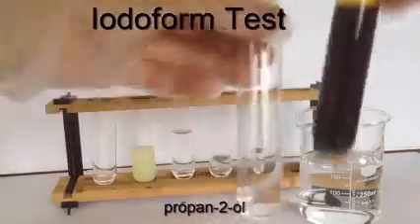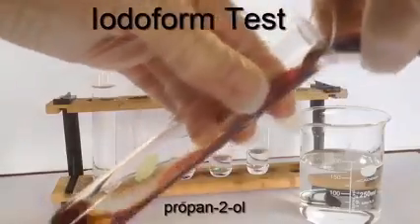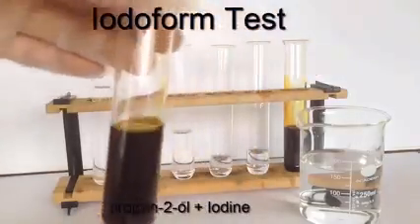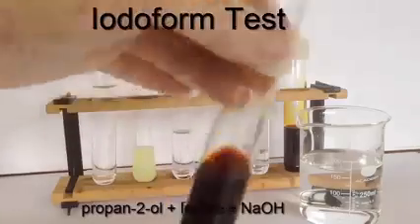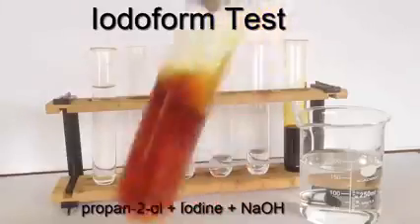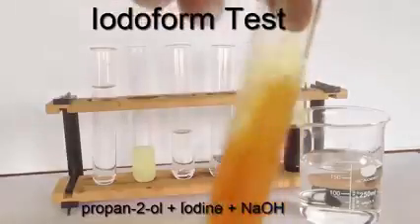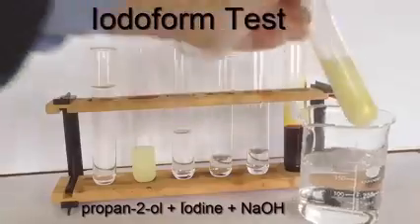So the position of the OH group on the 3-carbon chain is different. It's on the middle carbon rather than the outside carbon. So again, I've added my 10% iodine solution, and now I begin to add slowly with shaking the 2 molar sodium hydroxide solution. The brown color is fading, and we're looking for again one of two possible outcomes.